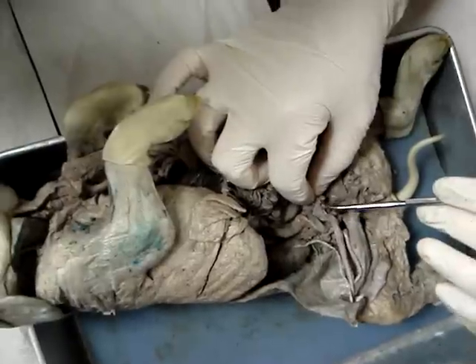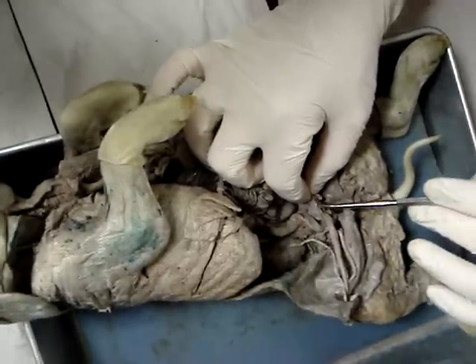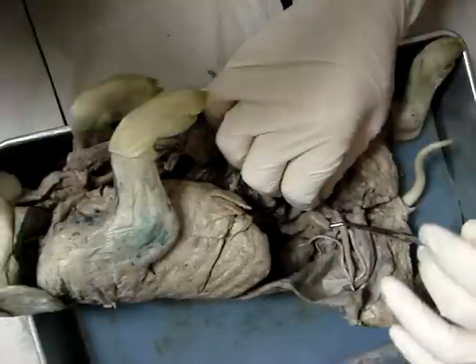Here's the piece of the uterus right here. Now with pigs, they have a Y-shaped uterus. It's different from humans, so they can be pregnant on the left and the right sides.